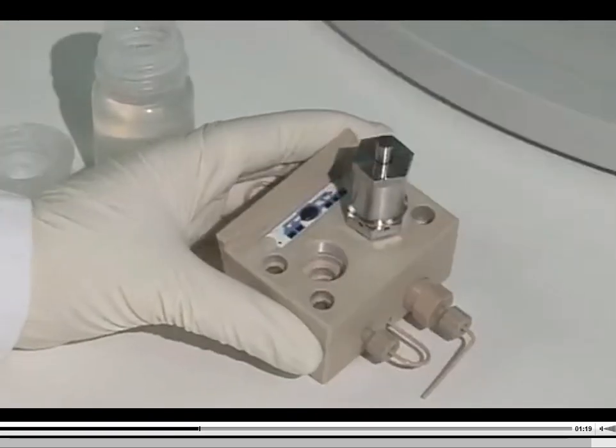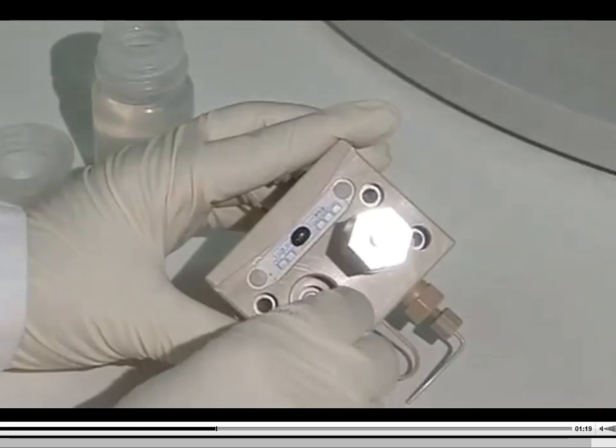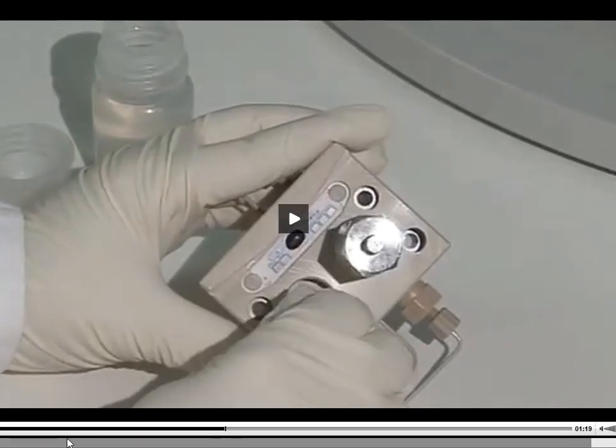This is kind of a guide in a way to take the sample and the piston where it needs to go. Now what you're seeing is that this person has taken a fancy little tool that Metrohm has given you in your supply kit. You should have one of those around somewhere. And that tool is to go in and basically change these valves.